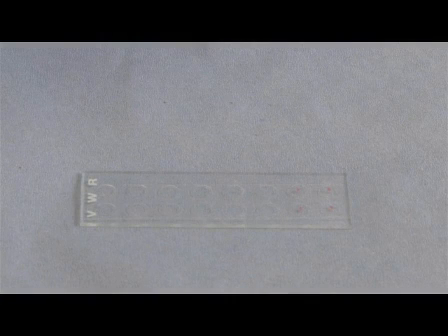This video article will describe the method of harvesting and cryocooling crystals grown by the in-meso method.